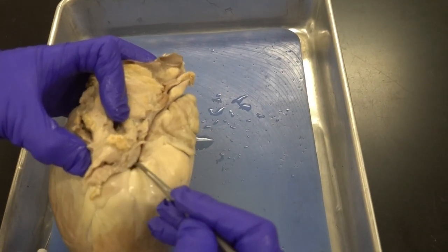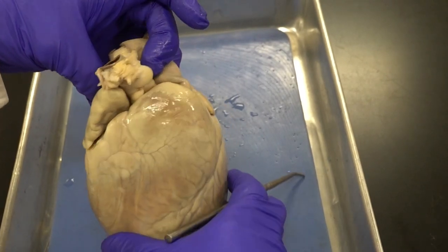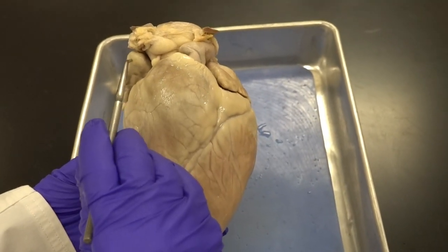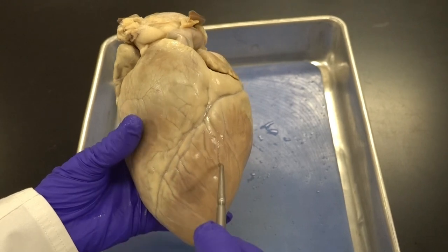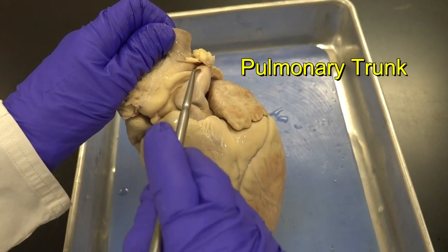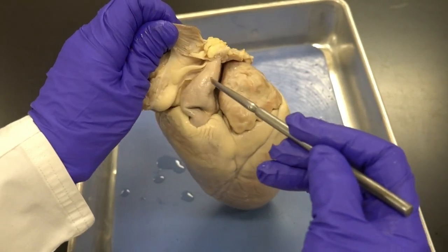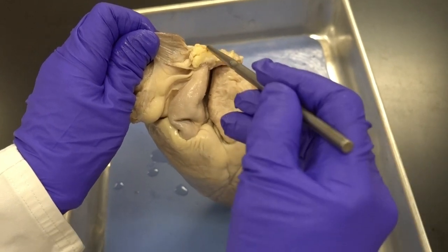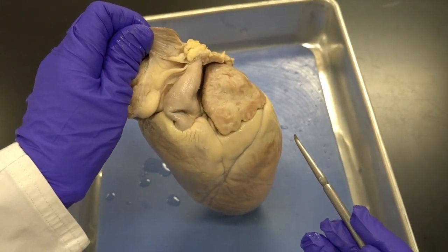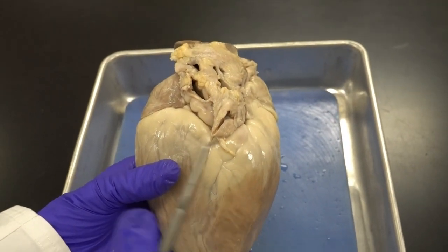The coronary sulcus continues around between the right atrium and right ventricle. In the anterior view I can see the two atria — right versus left — and the two ventricles — right versus left. Here we have a beautiful view of the pulmonary trunk, the artery into which the right ventricle pumps deoxygenated blood. The pulmonary trunk divides into two pulmonary arteries that send blood to the lungs, where it becomes oxygenated.